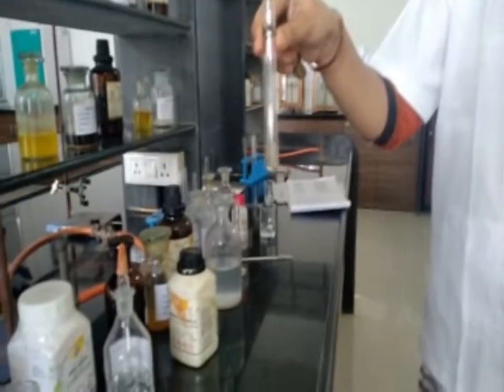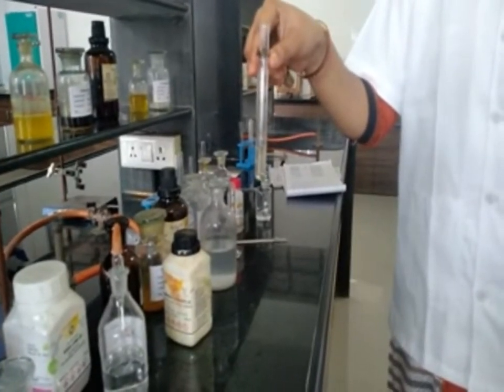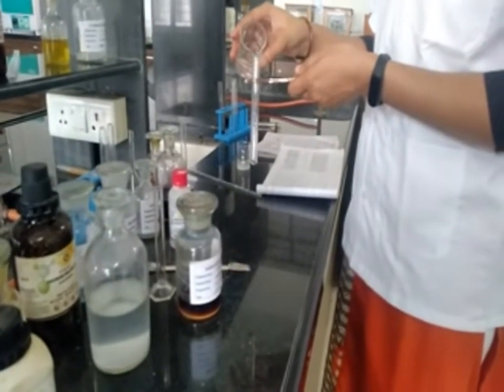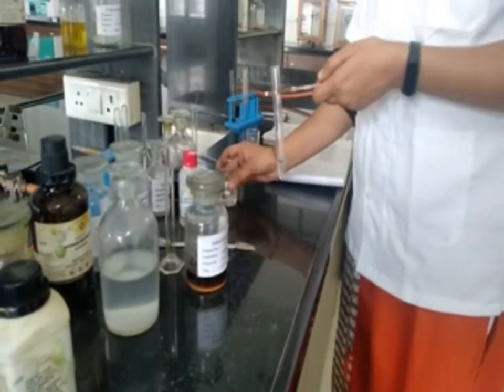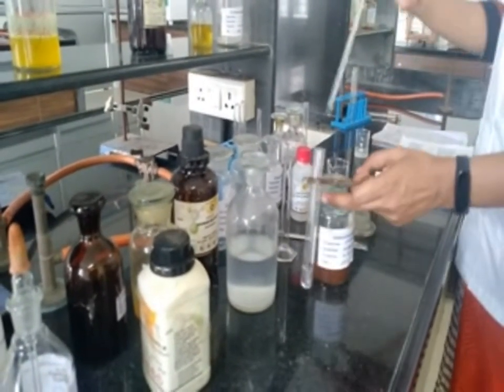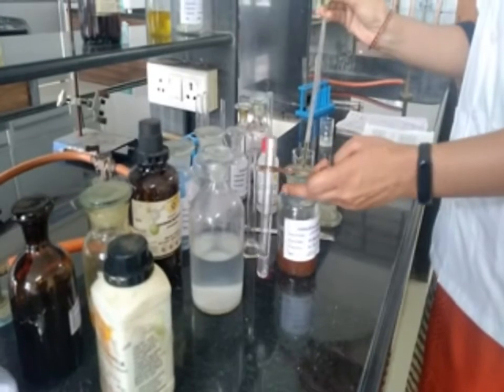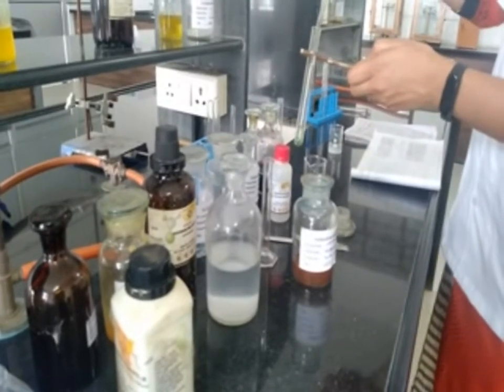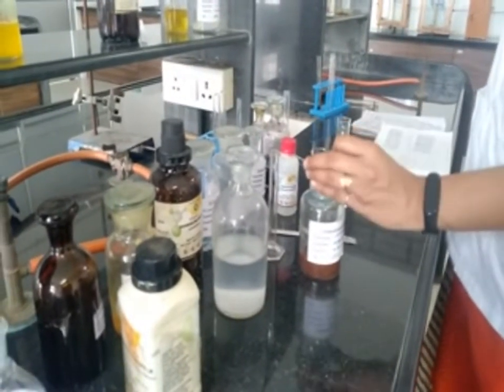Test for sulfur — sodium nitroprusside test: take 2 ml of sodium fusion extract, then add 1–2 drops of freshly prepared sodium nitroprusside solution, shake vigorously and observe. It does not show a purple or deep red color, which means sulfur is absent in the given compound.